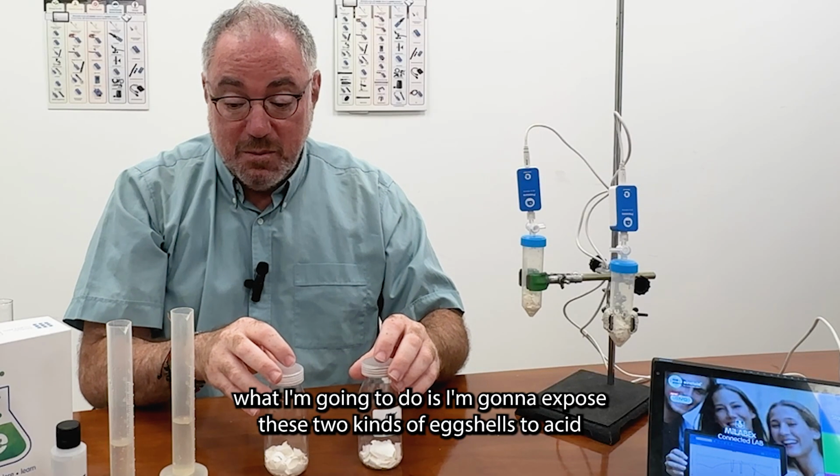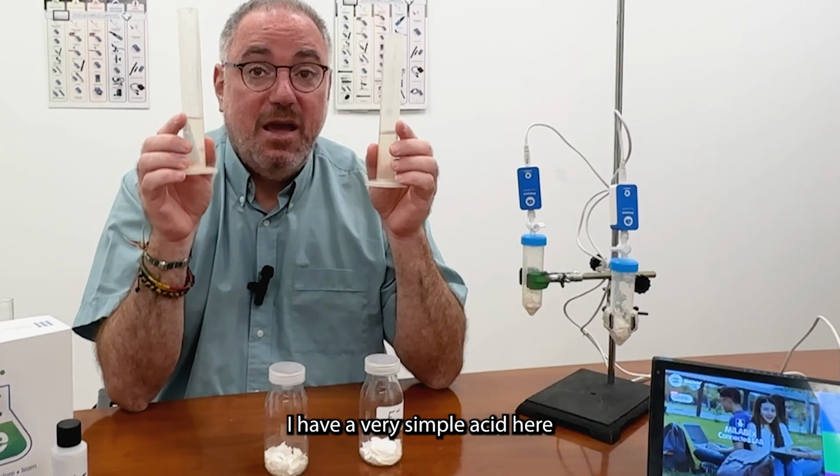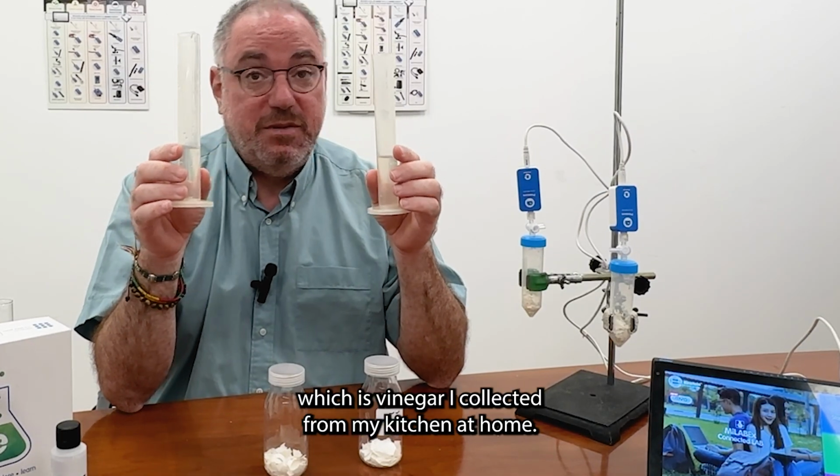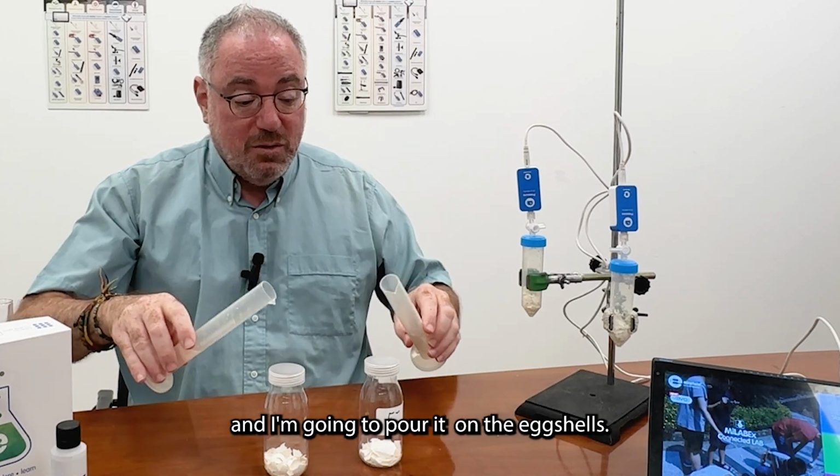What I'm gonna do is expose these two kinds of eggshells to acid. I have a very simple acid here, which is vinegar I collected from my kitchen at home. And I'm gonna pour it on the eggshells.